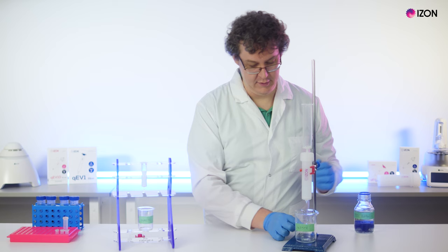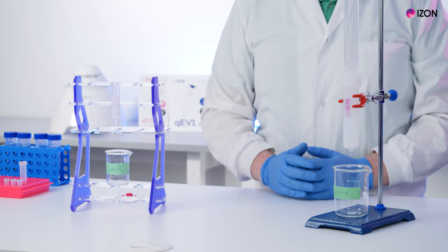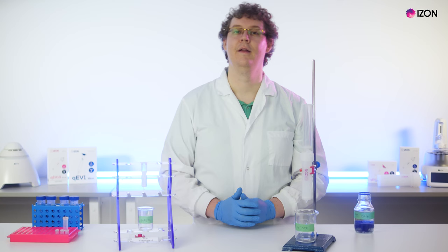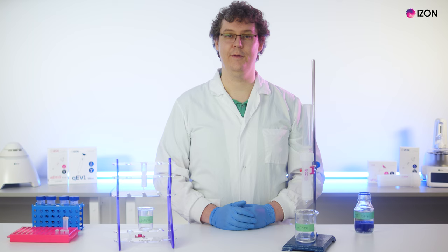Remove the bottom cap and check that the column begins to flow until the buffer reaches the frit, at which point it should stop flowing.